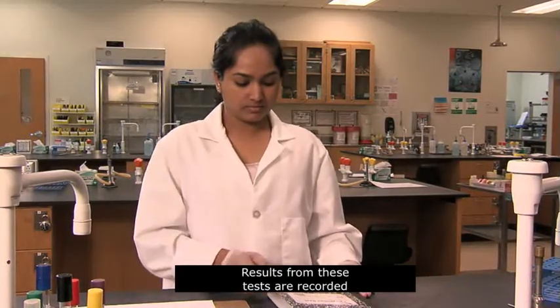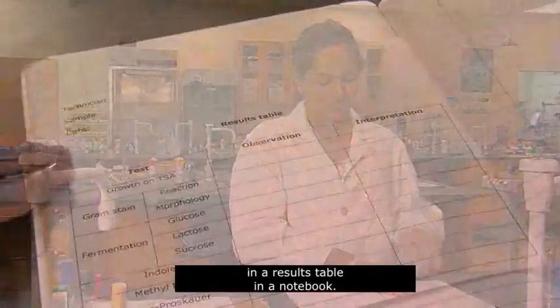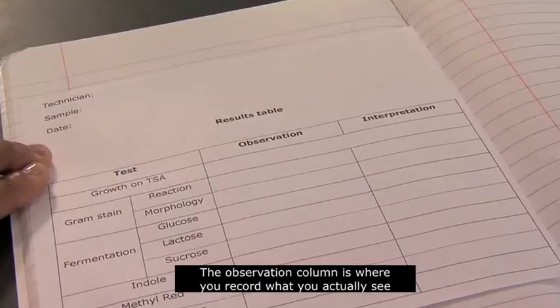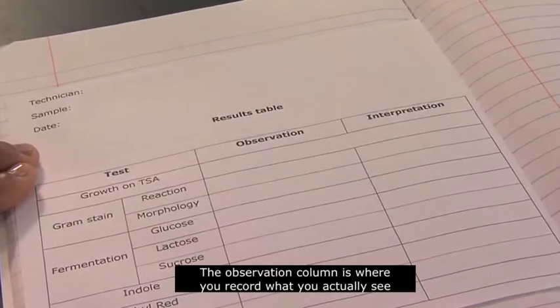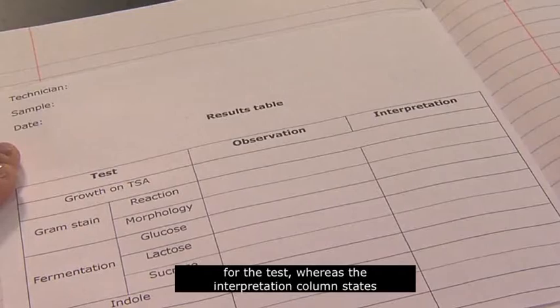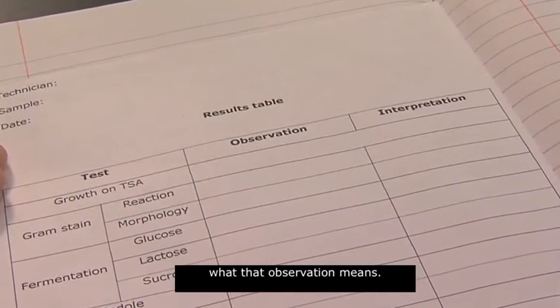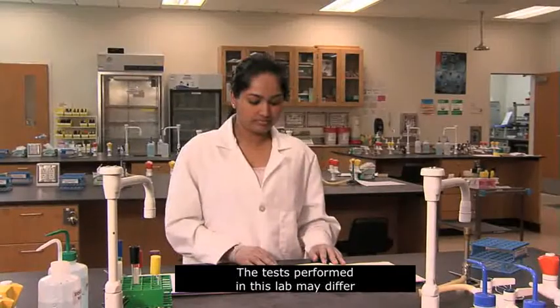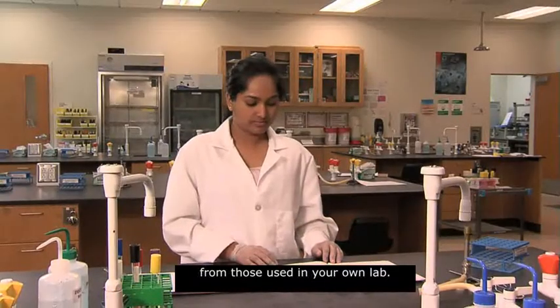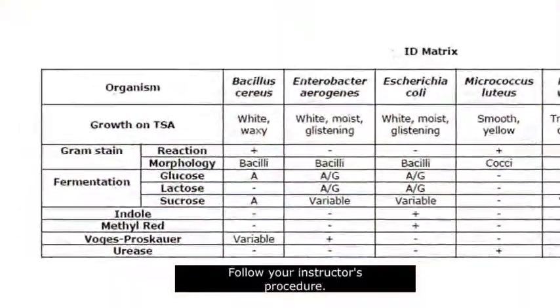Results from these tests are recorded in a results table in a notebook. The observation column is where you record what you actually see for the test, whereas the interpretation column states what that observation means. The tests performed in this lab may differ from those used in your own lab. Follow your instructor's procedure.